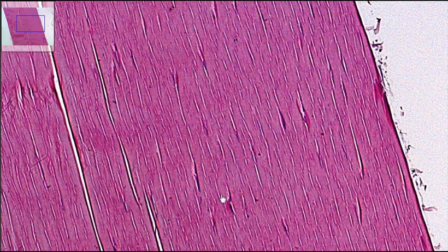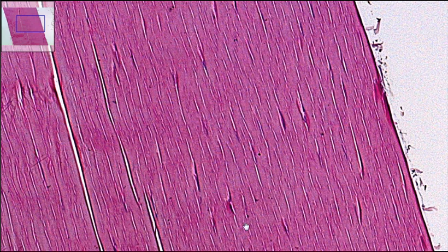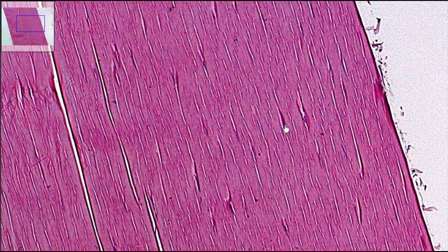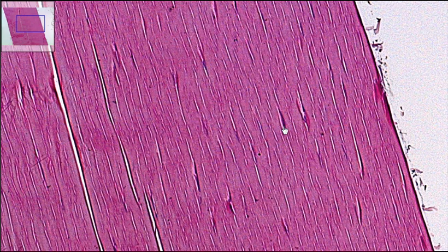Secondly, the cells. You can see one nucleus here, one down here, one up here. It's a darker, more elongated looking cell.